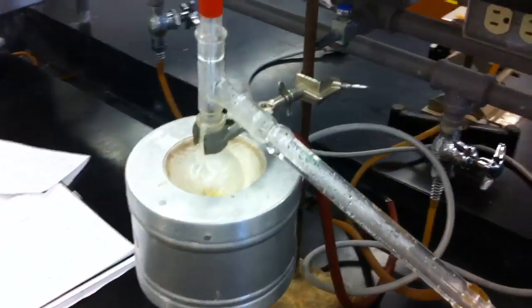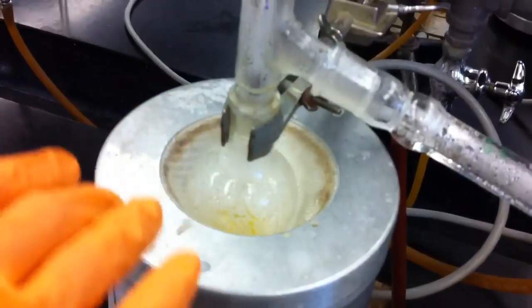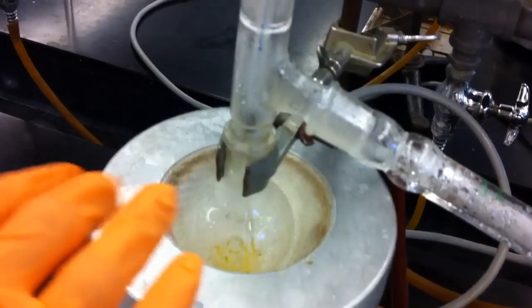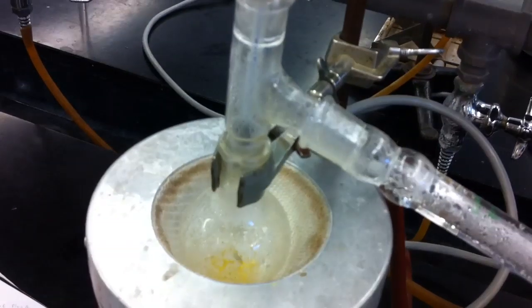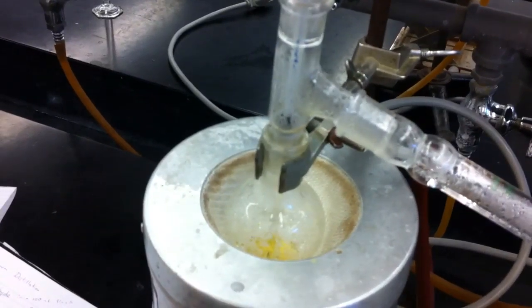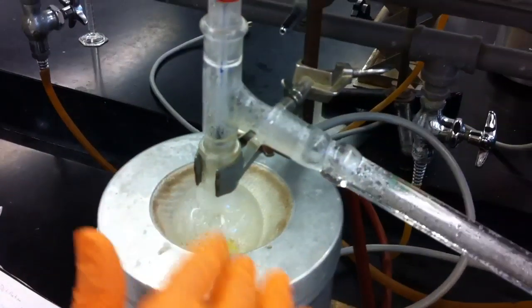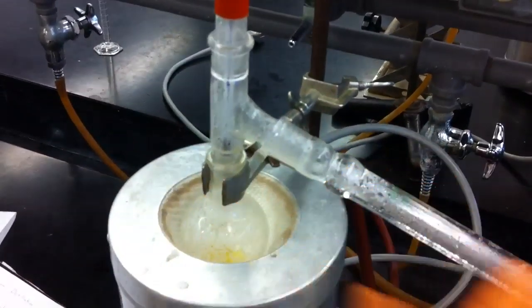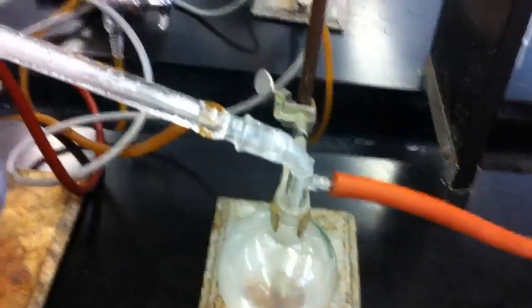Okay, now here we have the pot and inside the pot we have 20 milliliters of benzaldehyde. We used the 100 milliliter flask in order to fit our 20 milliliters and not to overflow, because then we would have some stuff going from here to here and this product would end up contaminated.